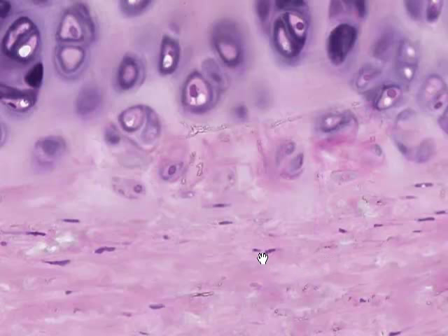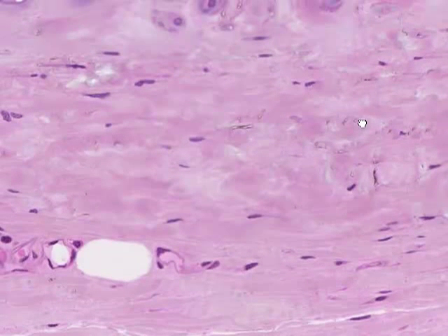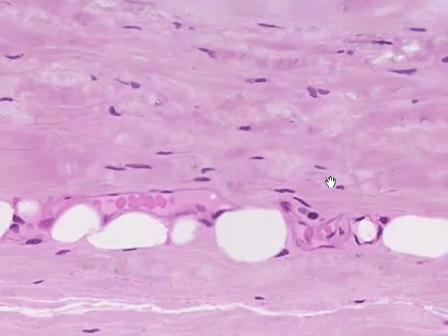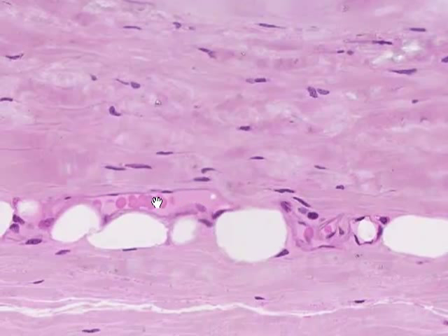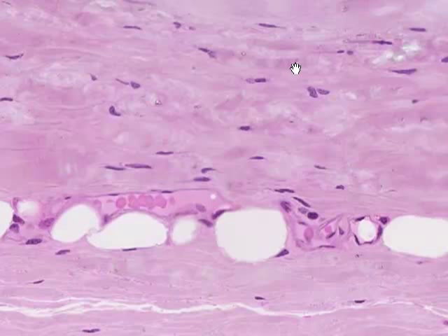On the outer edge of this cartilage we have some collagenous connective tissue with fairly undifferentiated looking cell nuclei — maybe fibroblast-style nuclei. Just along here is where the perichondrium is found, and it then blends with the surrounding connective tissue. Here we can see a blood vessel that contains some red blood cells, and some of these spaces here perhaps are where adipocytes were.